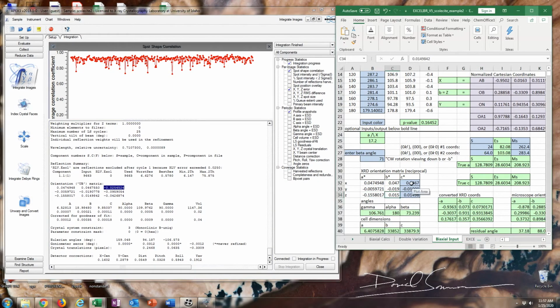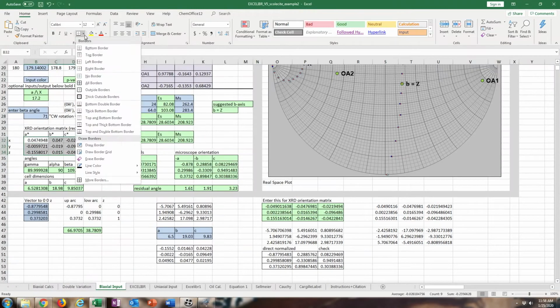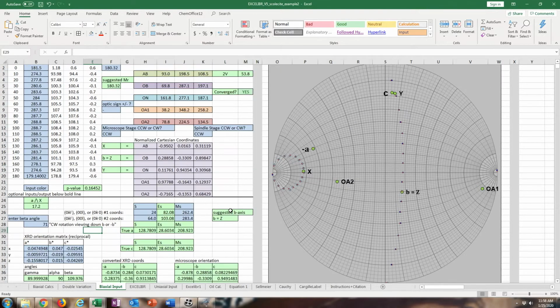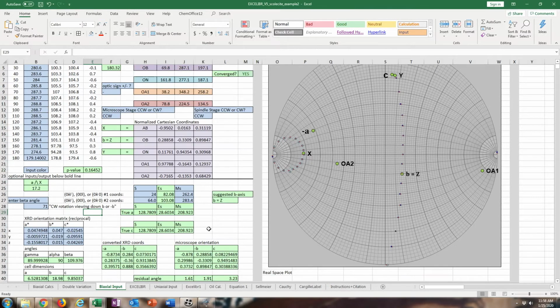Alright, so this will just recalculate all those dimensions that are already listed. It won't plot it, but it'll give you the residual angle between your converted X-ray orientation and your microscope orientation. And as you can see, I also have to enter in the beta angle, which is 109.976.